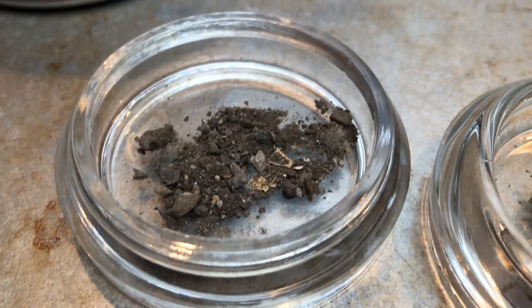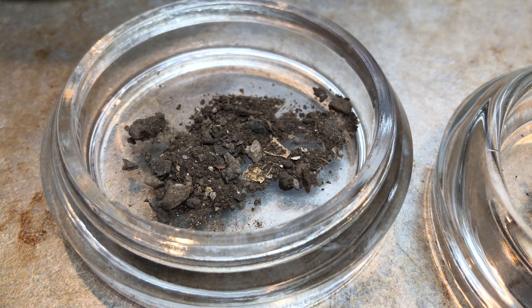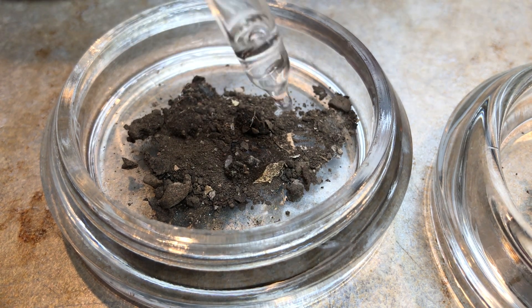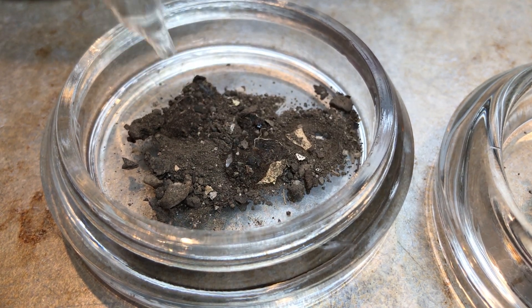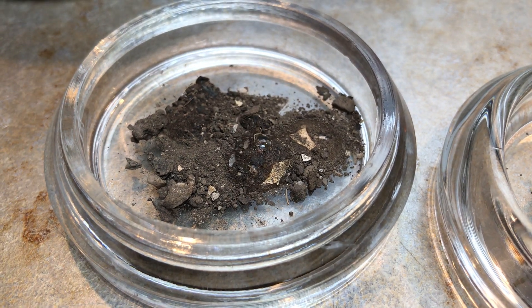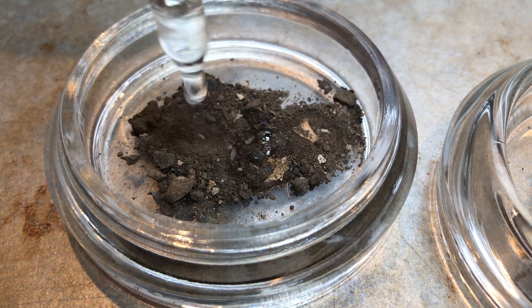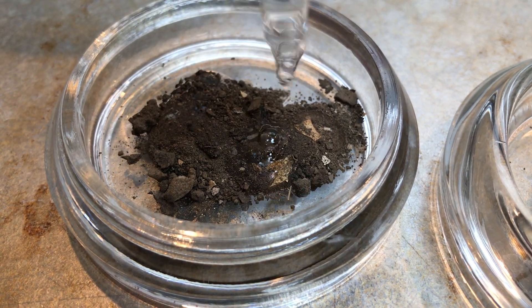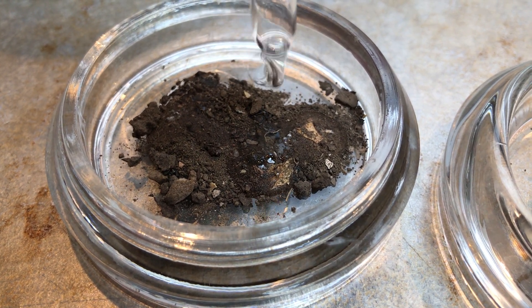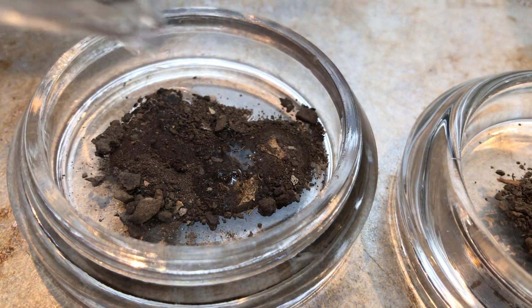So Bridget, why don't you start with our crime scene sample. Just put it all over a bit more. Get another drop because there's a lot of soil. We tried to get a good sample of all the different materials in the soil, because you're never quite sure which ones are going to have calcite and which ones aren't. Just give it a little bit more since there's a lot of soil in there.